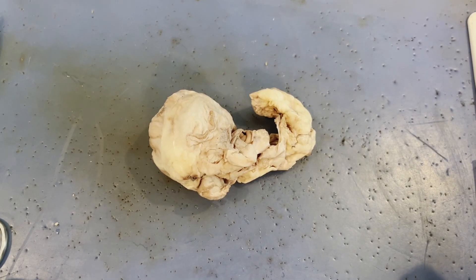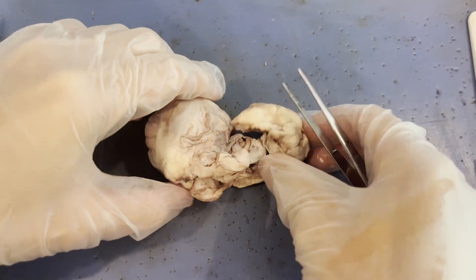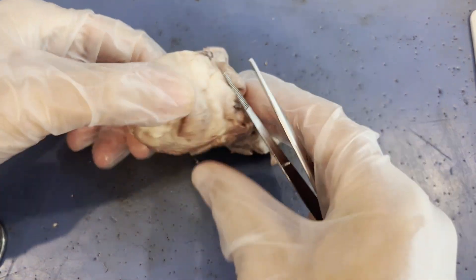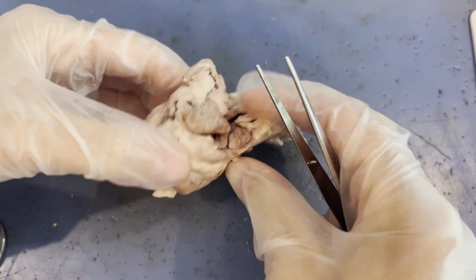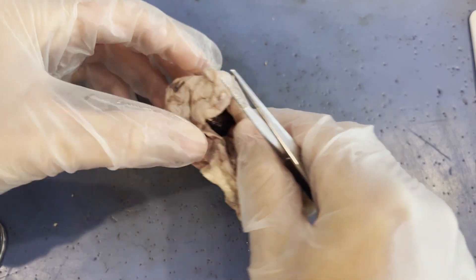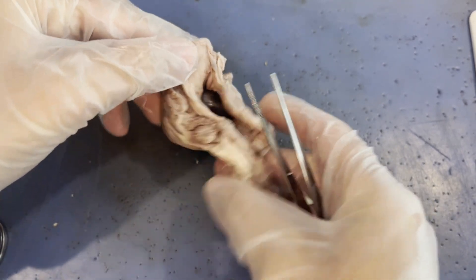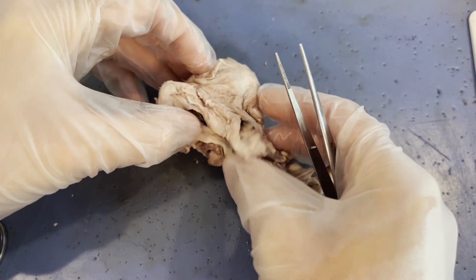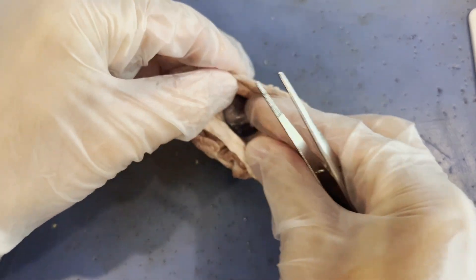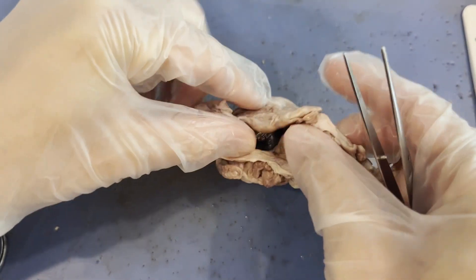All right, let's dissect an eye. When you look at the cow's eye it almost looks like this could be any part of the cow's body. If your eye arrives looking like this with all this extra tissue, just know that the eye is inside all of that tissue.